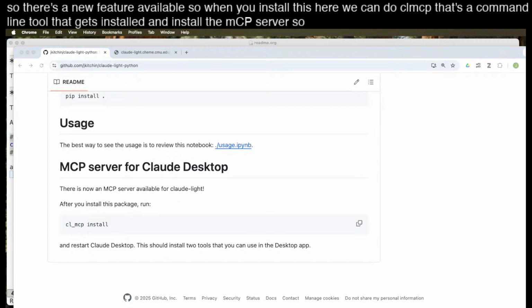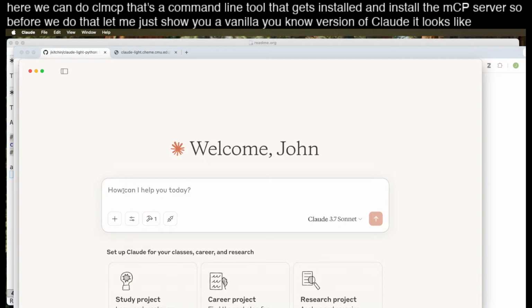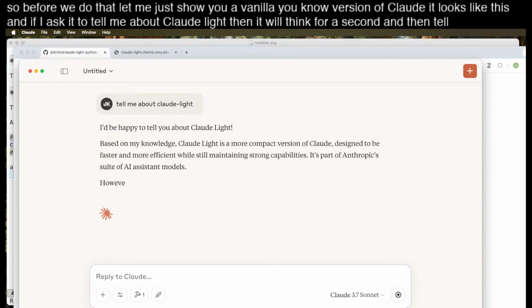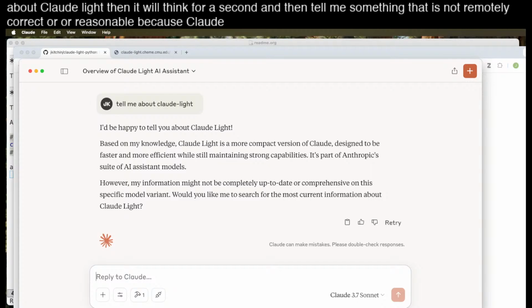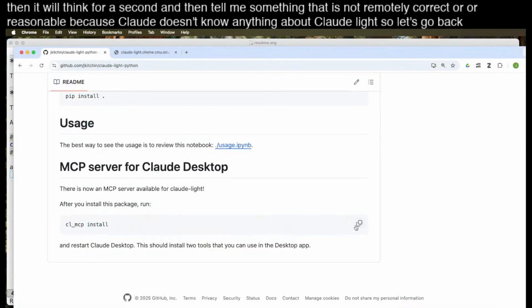So before we do that, let me just show you a vanilla version of Claude. It looks like this, and if I ask it to tell me about Claude-Light, then it will think for a second and then tell me something that is not remotely correct or reasonable, because Claude doesn't know anything about Claude-Light. So let's go back here and follow these directions.